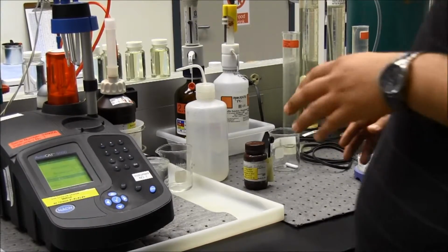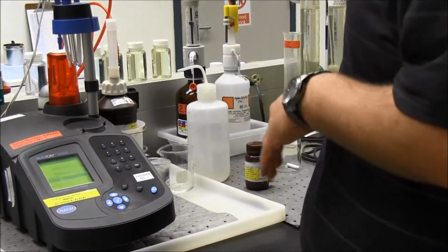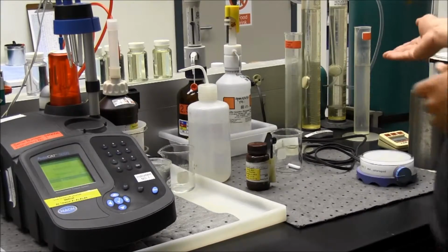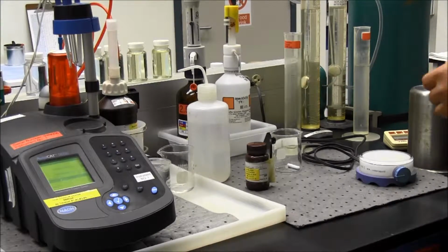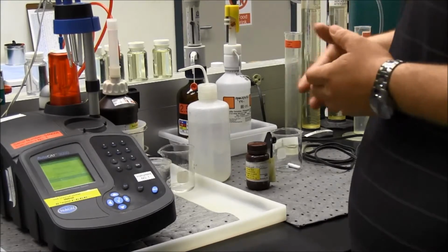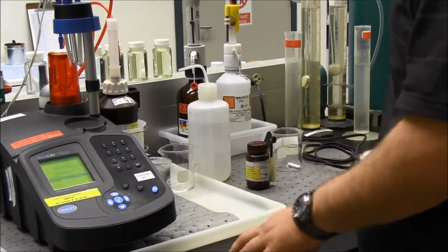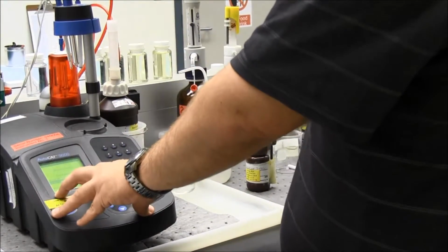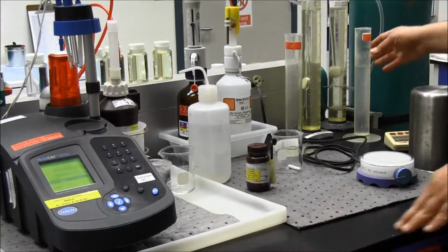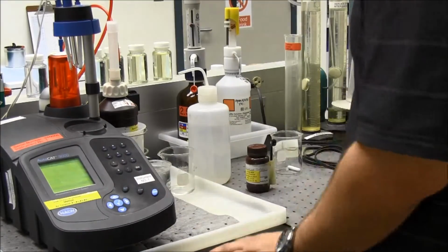Okay, so we're done with the first test, the first 2 titrations. So now in the third and fourth titration, we're going to use our other 200 milliliters of sample water that I had already purged for 15 minutes, because it will require you to purge that sample. So if you don't do that, then you're going to have to sit here for another 15 minutes and purge the sample and wait. So it's going to say renew sample with another 200 milliliters of water, which I have here, already purged. I'll hit OK, confirm, number 1.